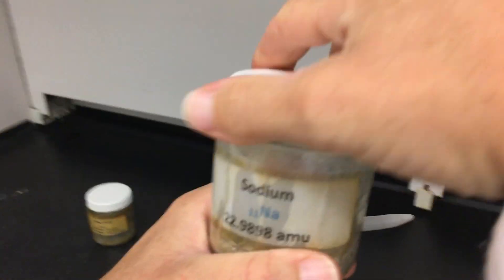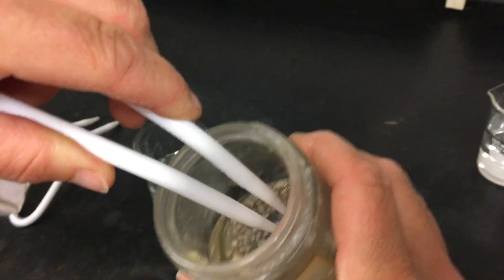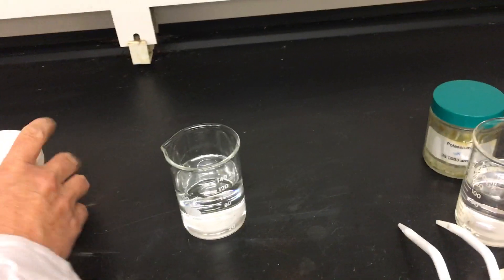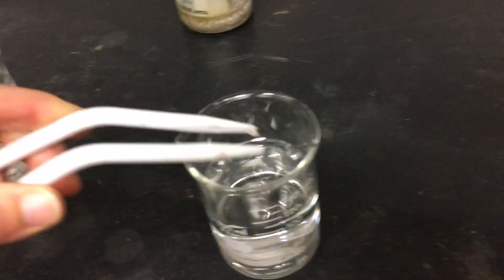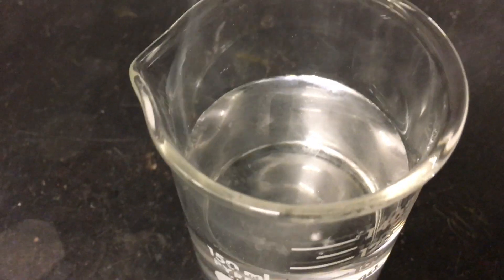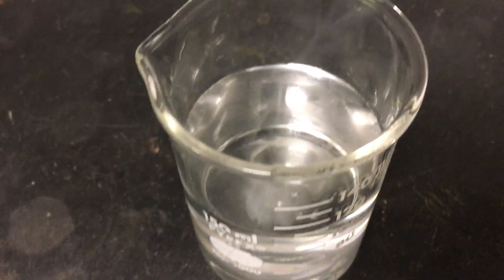Our sodium, again, is stored in oil. Let's grab a piece of sodium and add it to our water. We can see that the sodium is reacting with the water. Now we can think — is that more reactive or less reactive?